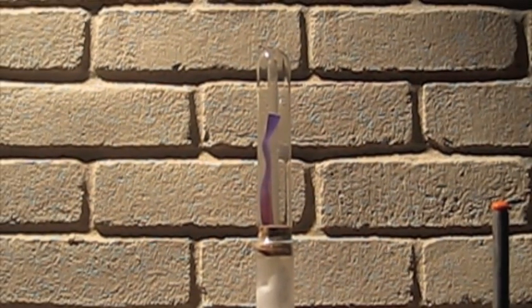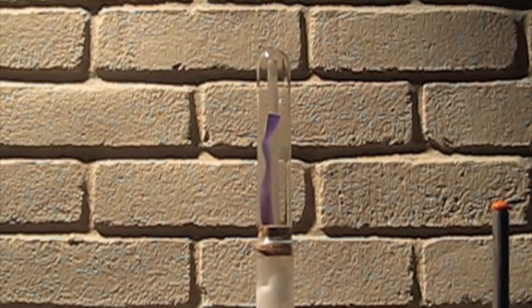This indicates that ammonia is being formed.